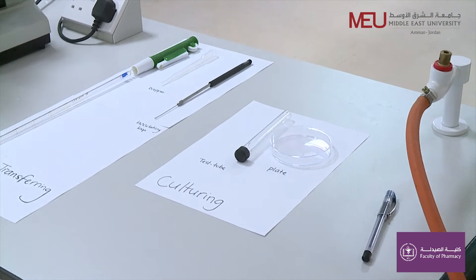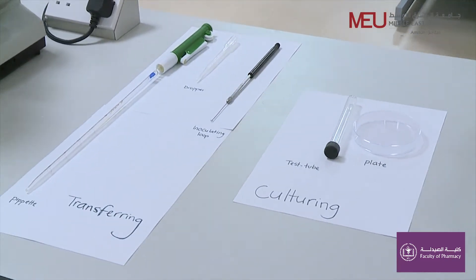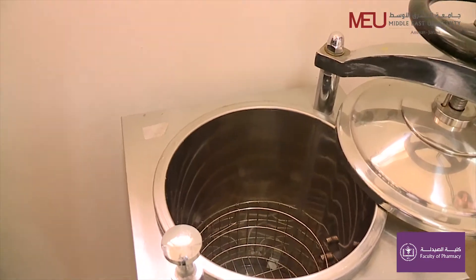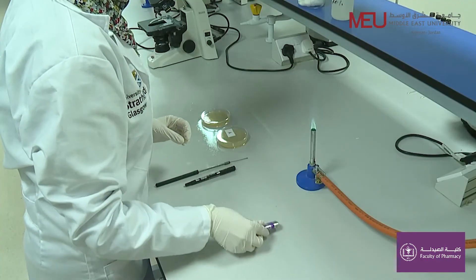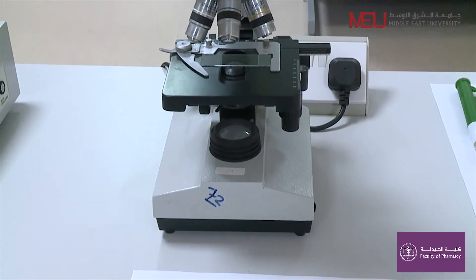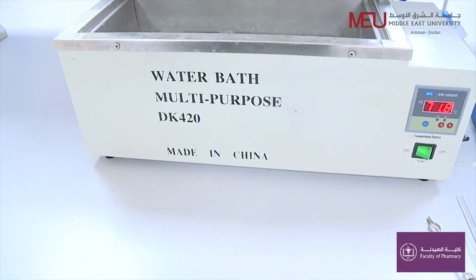Common tools used in the microbiology lab include transferring tools, culturing tools, sterilizing tools, storage tools, visualizing tools, and cultivating tools.